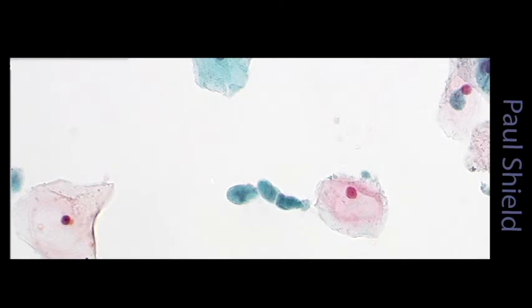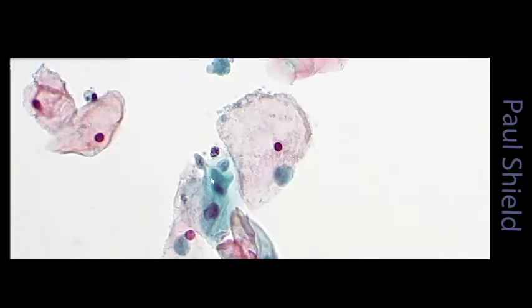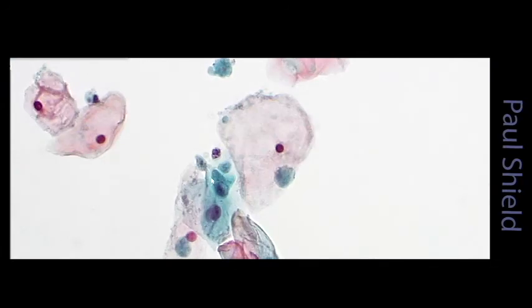So these are flagellates, but they lose their flagella during processing. You can see they appear as sort of grey to blue oval shaped bodies with a really indistinct little nucleus that is up one end of the cell, so like an eccentric pale nucleus in the cells.